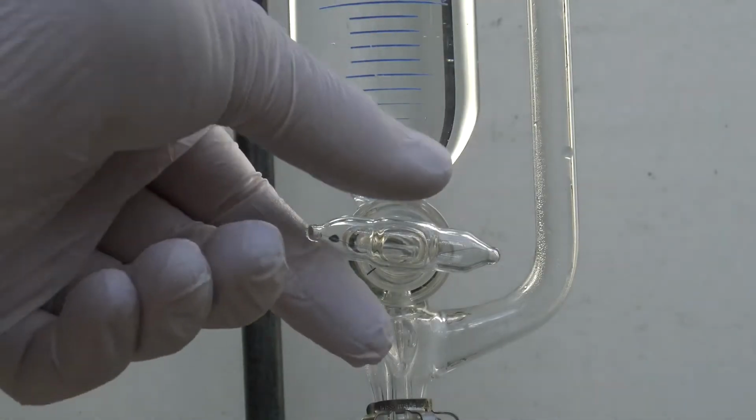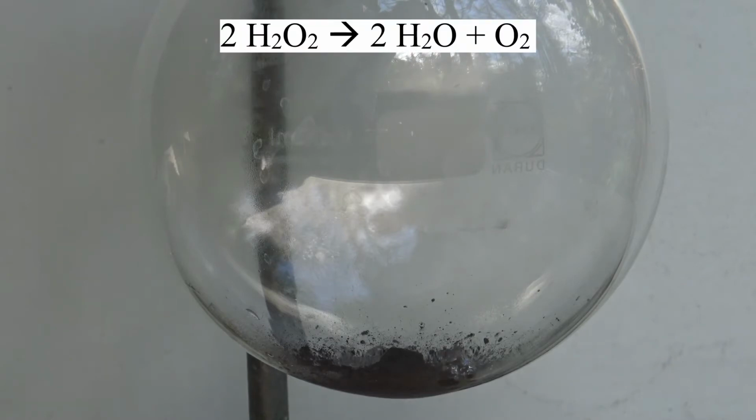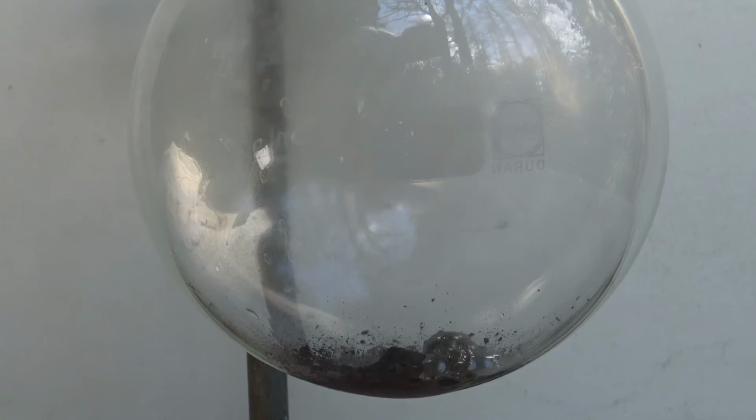Then the peroxide was added slowly to the manganese dioxide. The manganese dioxide catalyzes the decomposition of the hydrogen peroxide, and water and oxygen are formed. The high concentration of the peroxide caused a part of the water to be evaporated due to the heat of the reaction.